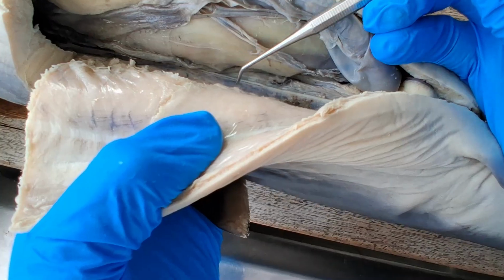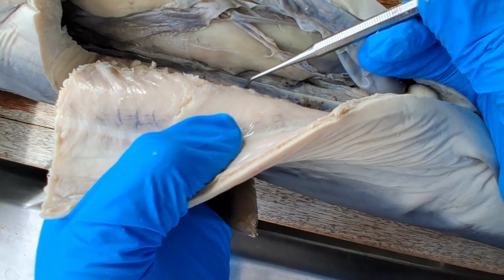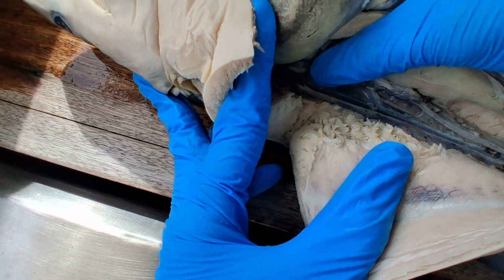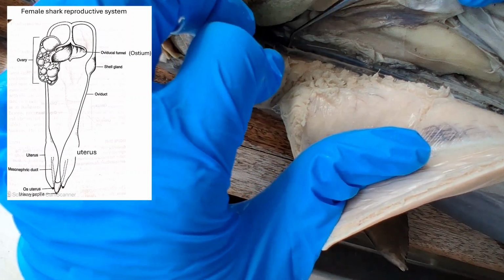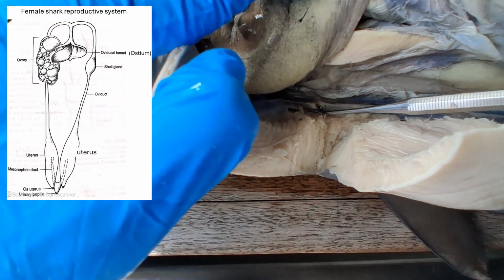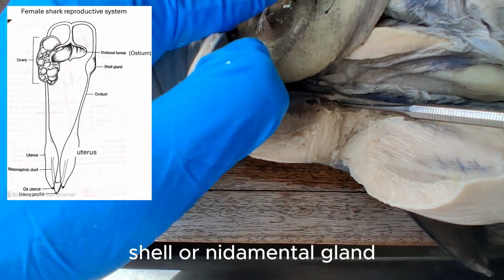So there are different types of kidneys amongst vertebrates. This is an opisthonephros or mesonephric type of kidney. That white line there is the oviduct, which has different segments. This expanded portion here is the nidamental or shell gland.